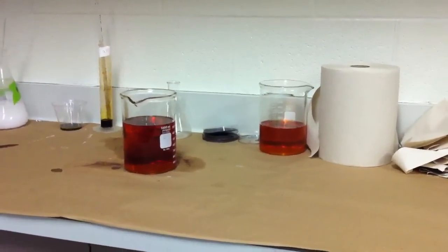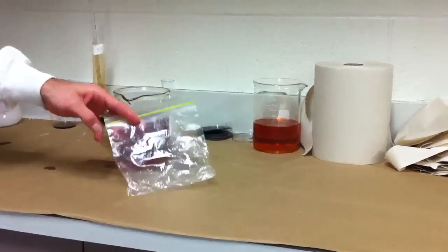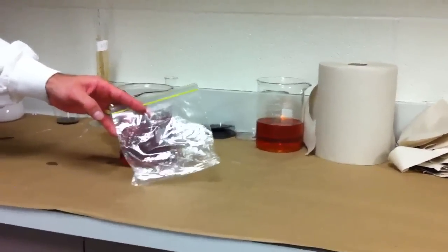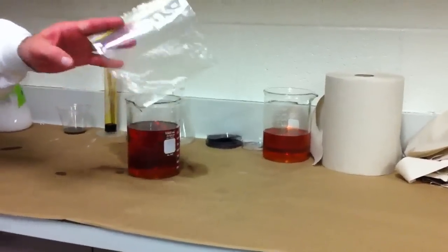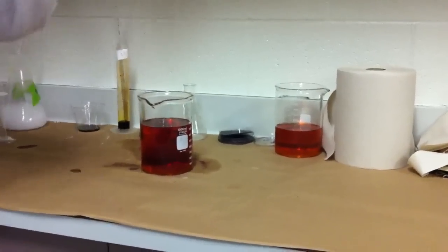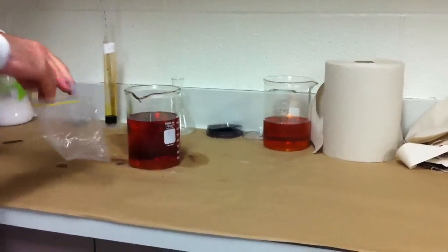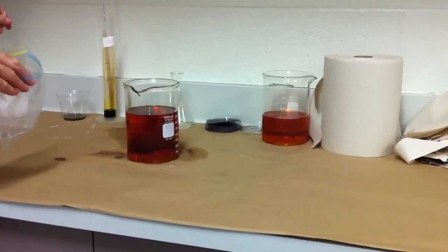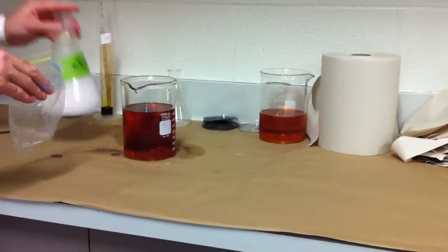We're going to take a plastic bag and our plastic bag is going to represent the plasma or cell membrane in this. This is our cell. Into our cell, we're going to pour some of the starch.